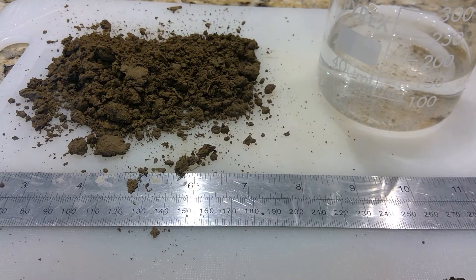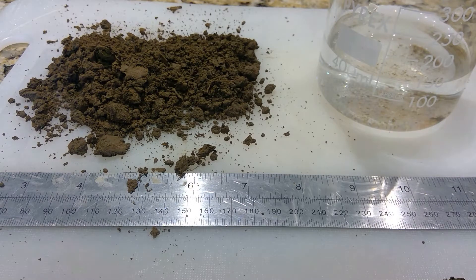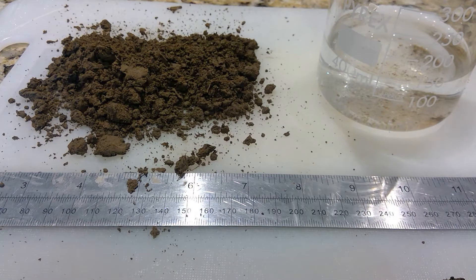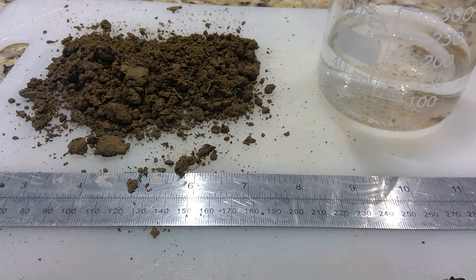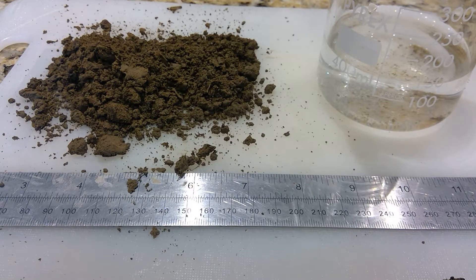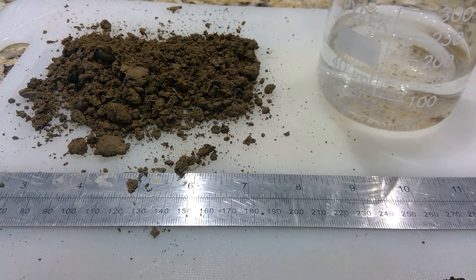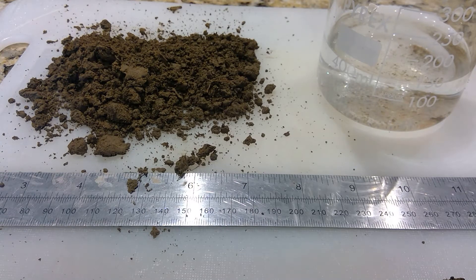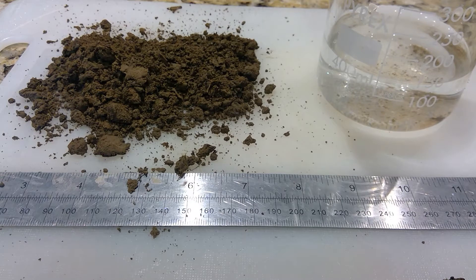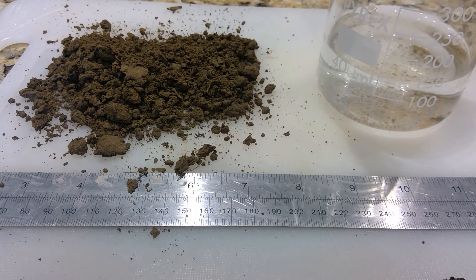Today we're going to look at determining the texture of a soil sample using the hand testing method. Soil texture is basically the composition of a soil in relation to sand, silt and clay, with sand being the coarsest particle and clay being the finest.